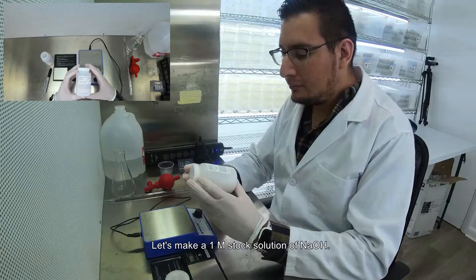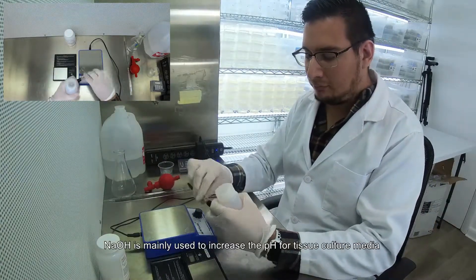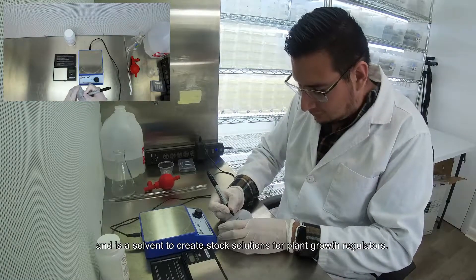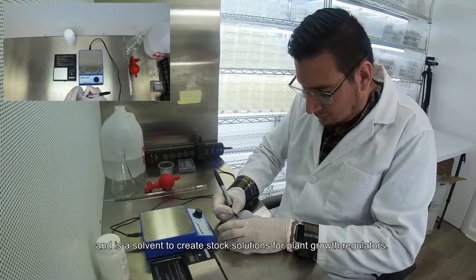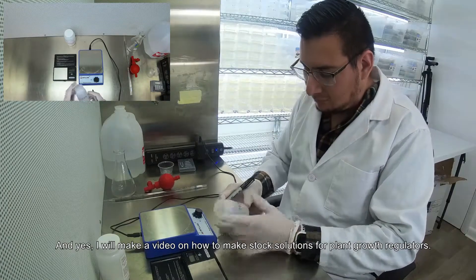What is going on guys, let's make a 1 molar solution of sodium hydroxide. Sodium hydroxide is mainly used to increase the pH for tissue culture media and is a solvent to create a stock solution for plant growth regulators.